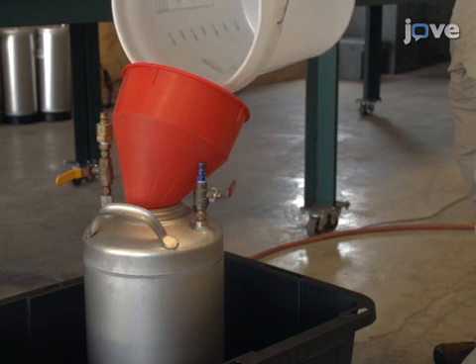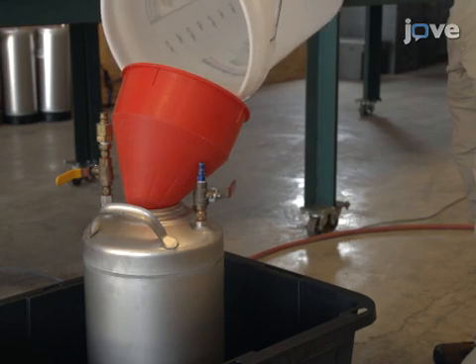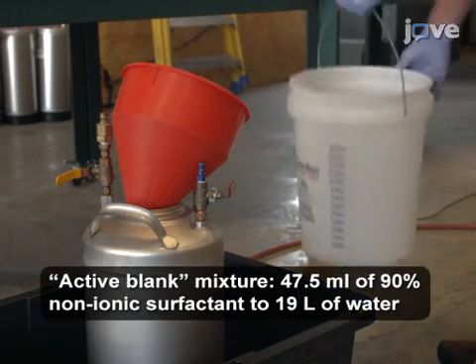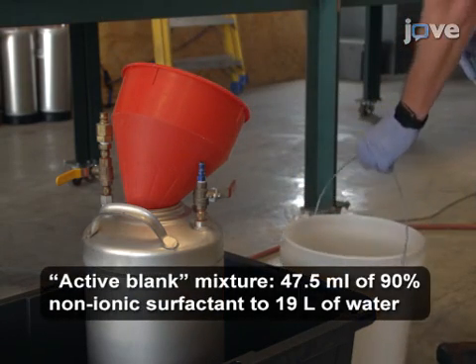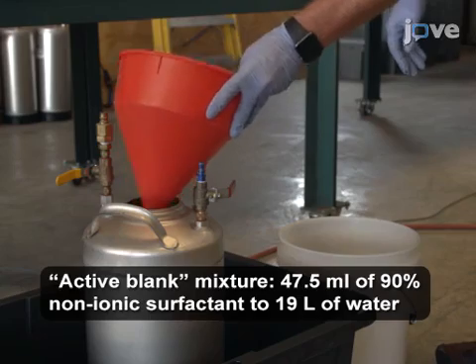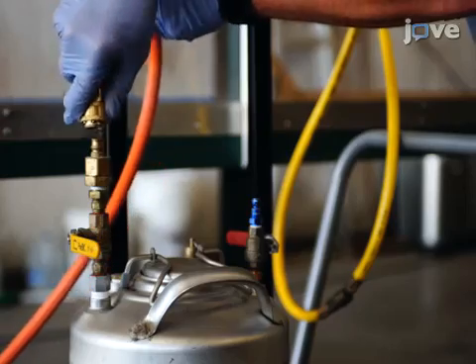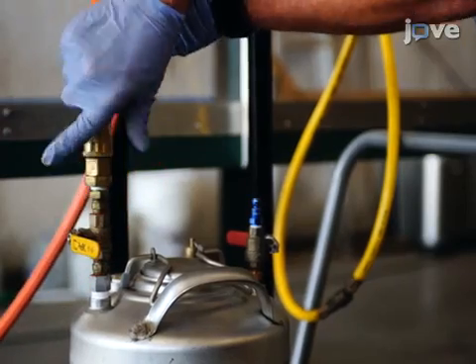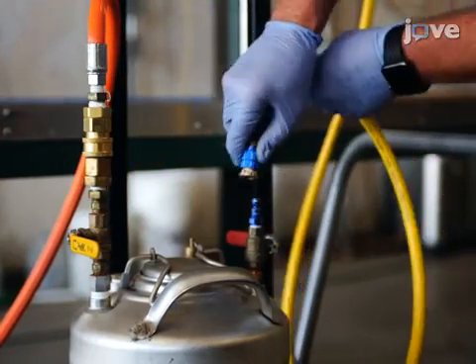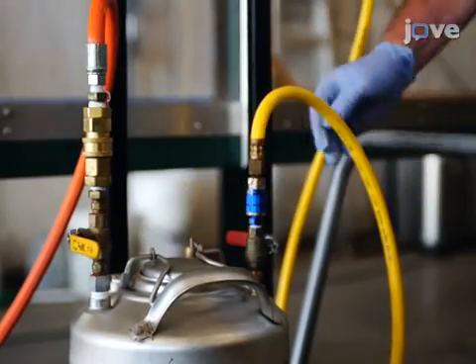Next, move to the stainless steel pressure tank used for the test mixture. Use a prepared active blank mixture to fill the tank with enough fluid for the planned tests. After filling the tank, seal it and ensure it is properly connected to both the air pressure hose and the hose to the nozzle.